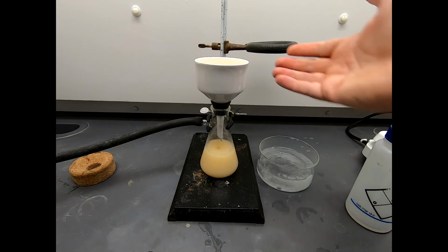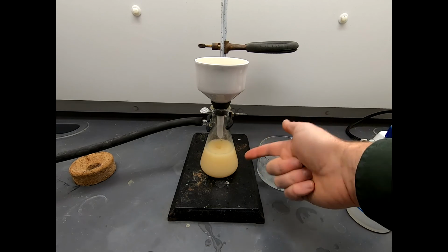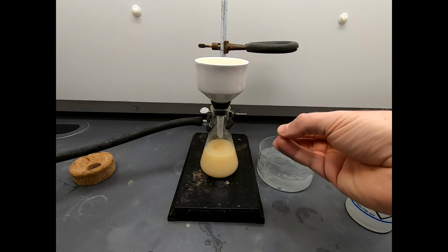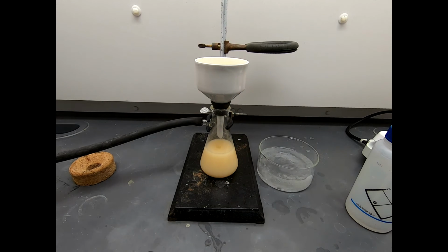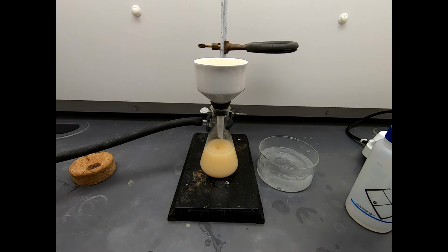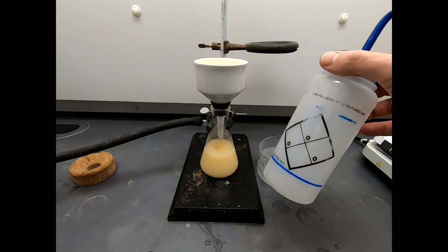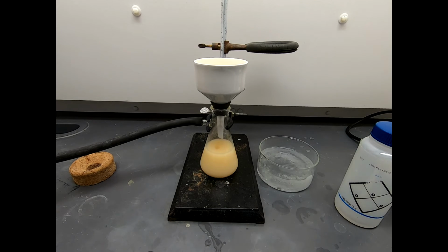And as I add more and more water to this, this goes from being an ethanol water mixture to more like a water solution with a little bit of ethanol in it. So some of the impurities, maybe a little bit of our product or benzaldehyde, is now less soluble, and that's what's causing that cloudiness. Anyway, I'm not alarmed. The procedure I'm following explicitly says that our product is virtually insoluble in water. So you can feel free to use as much water as you want to rinse off any excess base or anything else that's entrapped in that solid. So I think that looks good.